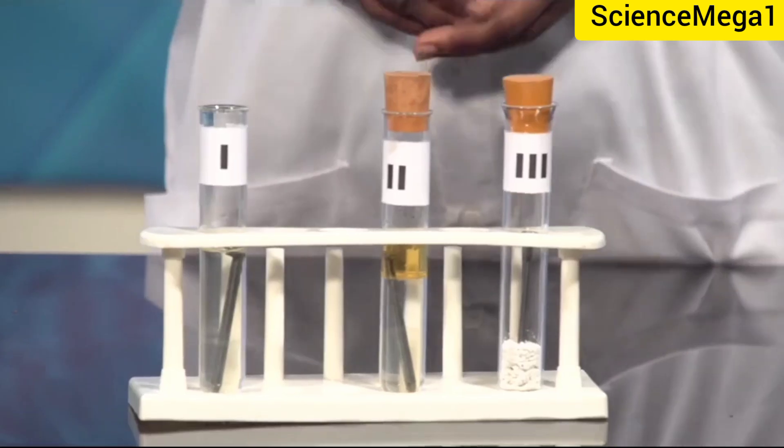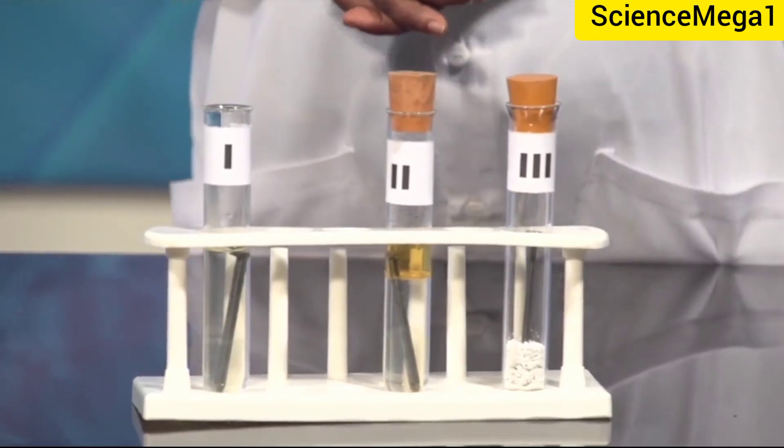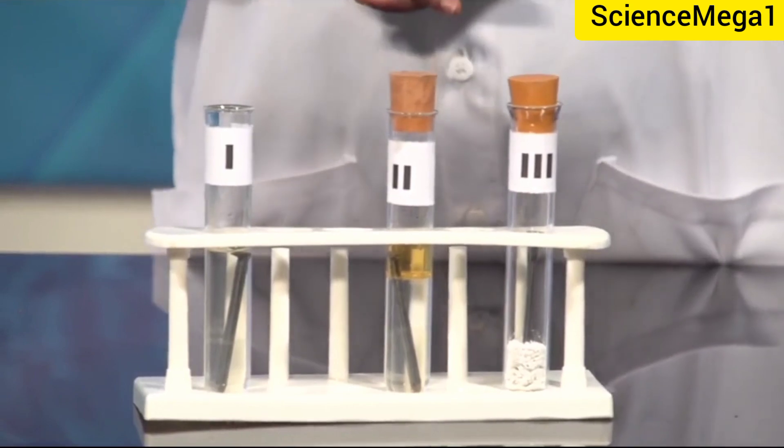We are going to leave the setup for at least three days and observe any changes in the appearance of the nails after the third day.